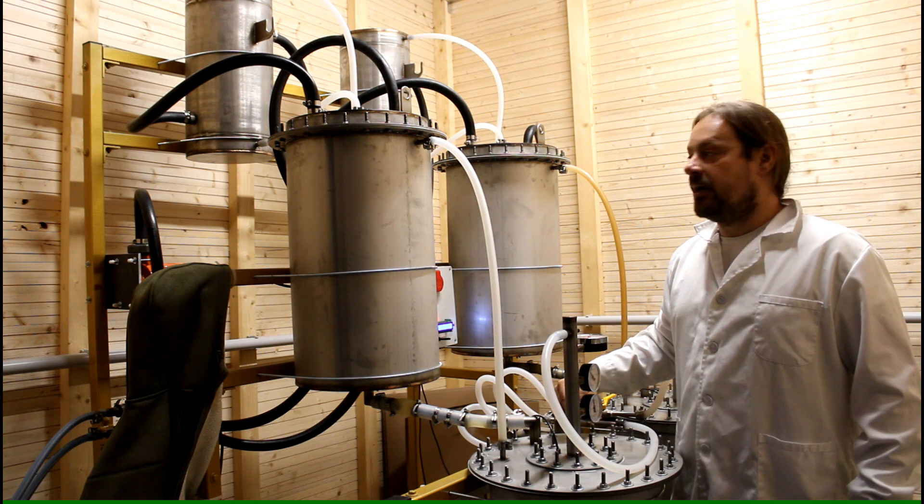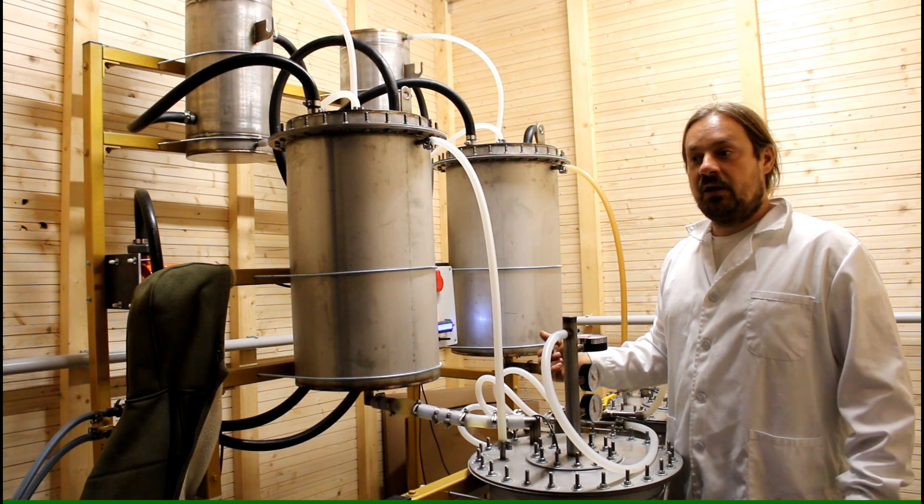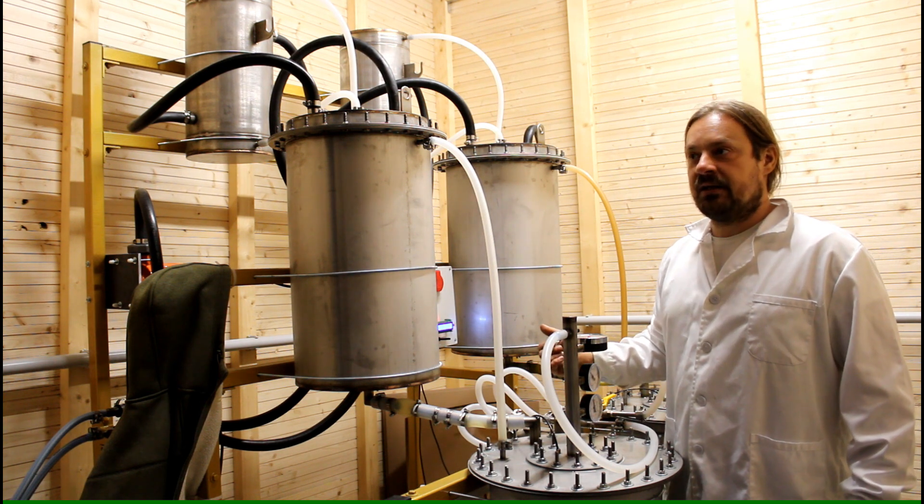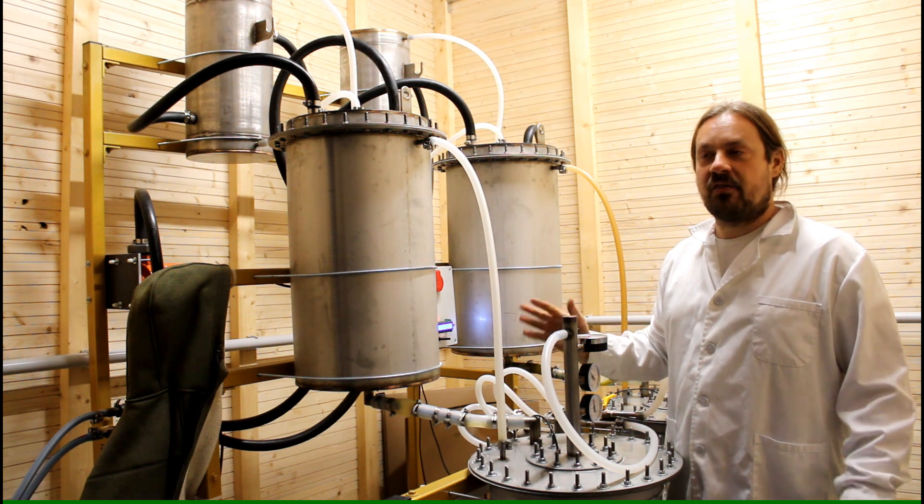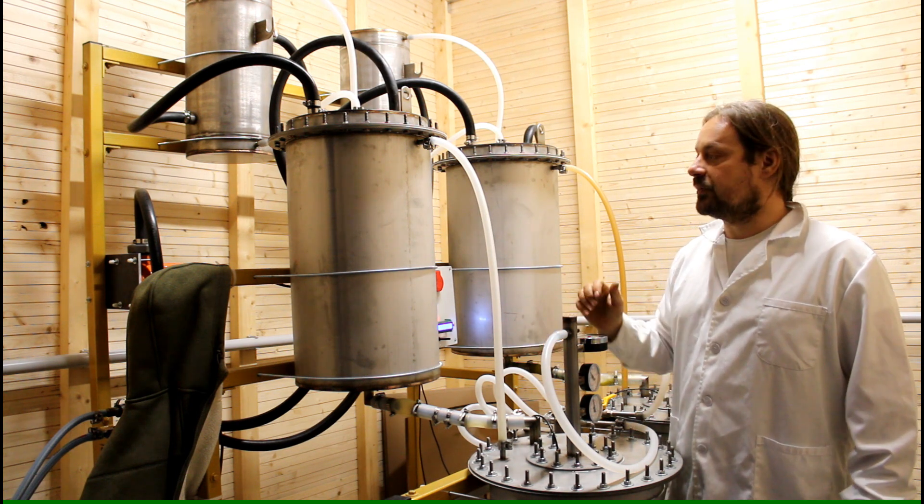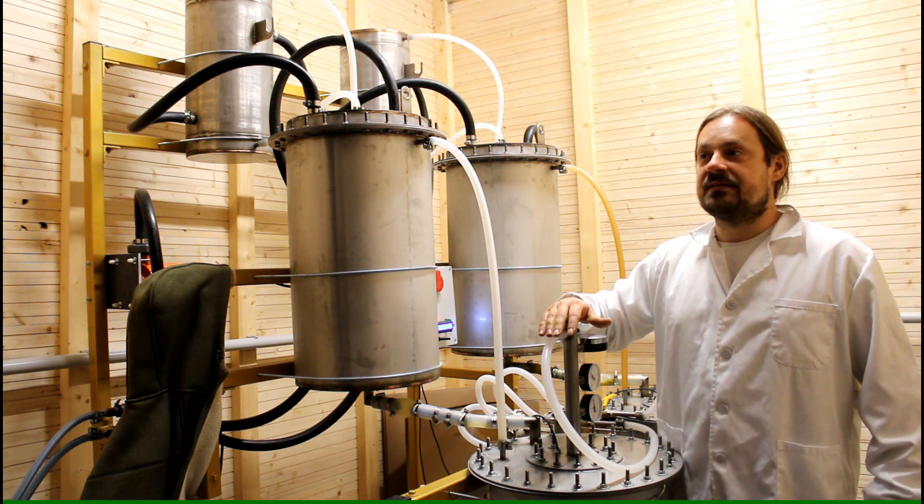And I can let the system run as long as I want. Usually the extraction is complete after about six hours and thirty minutes, something like that. But this also depends on the actual herb.